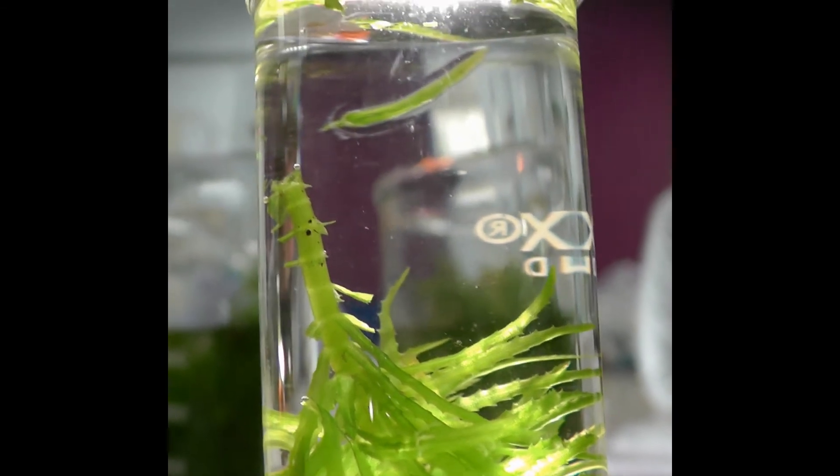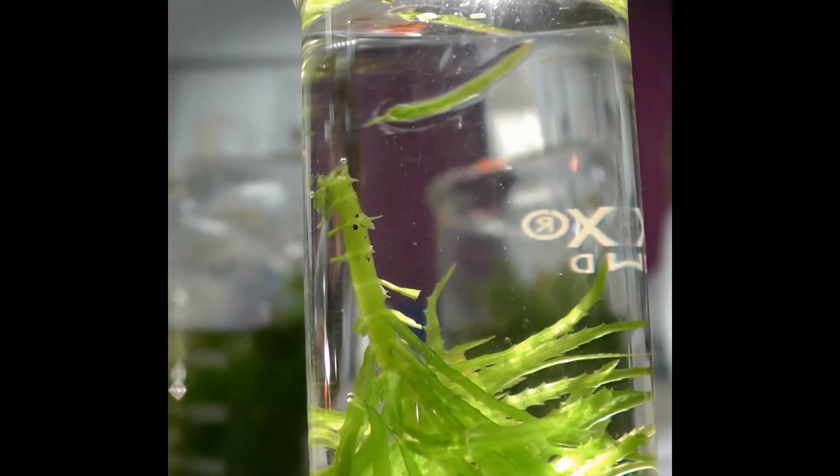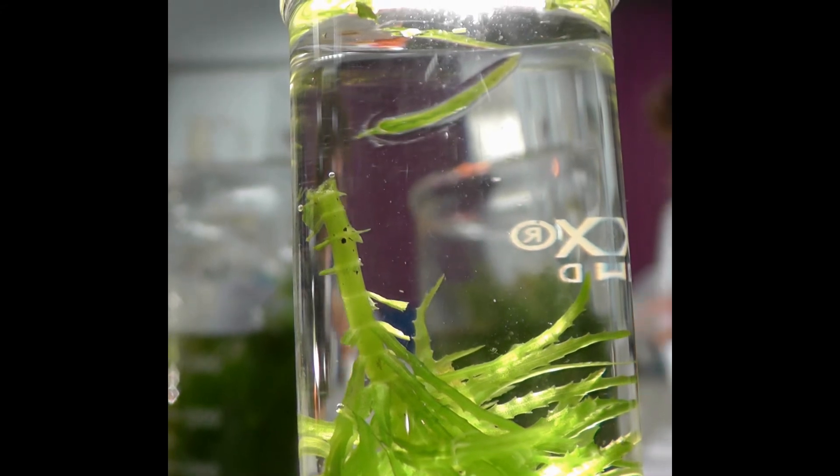It will produce oxygen from a cut end of the stem fairly reliably when placed in a solution of sodium hydrogen carbonate.